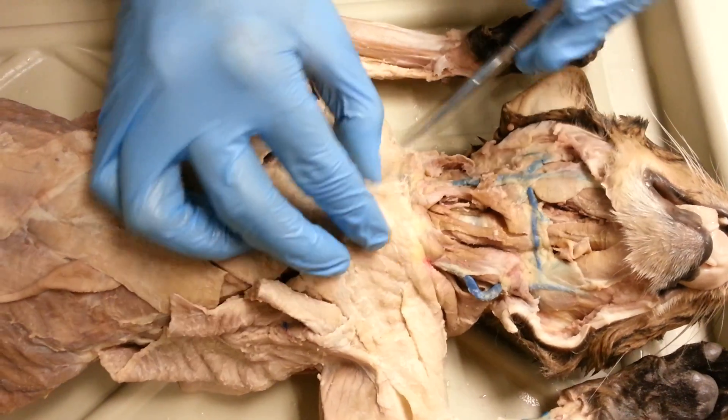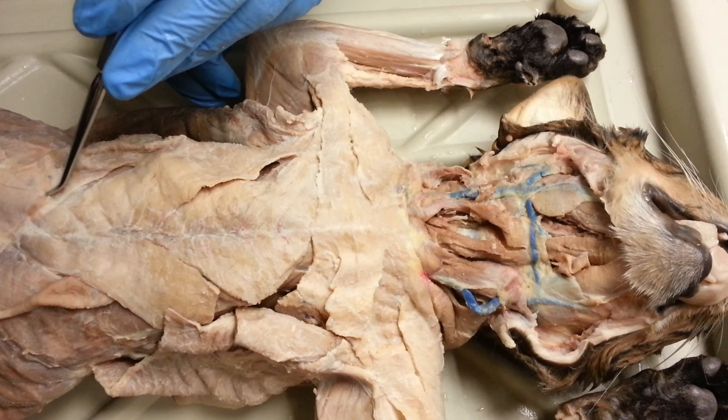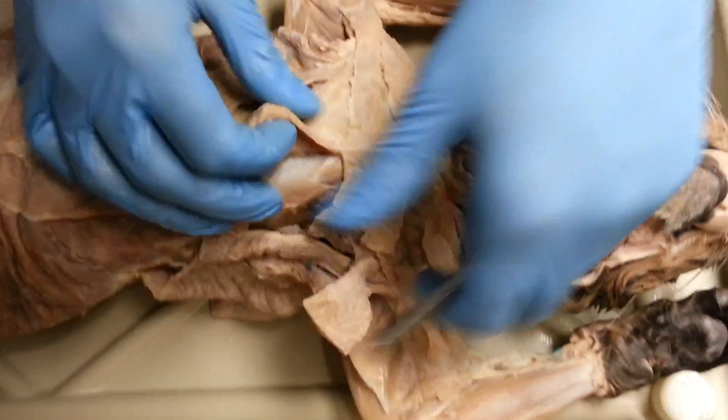The way I remember these ones is usually P, P, P, X. Works for me — it was really silly, but that's how I did it.